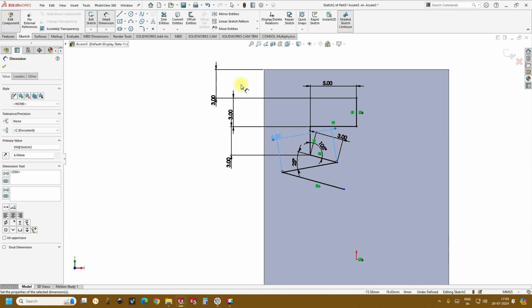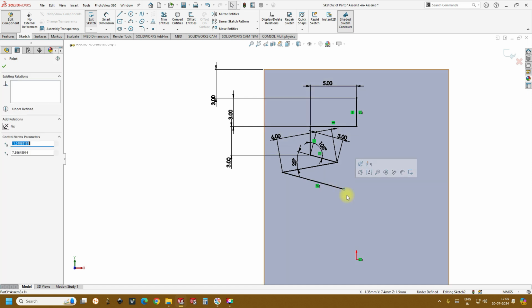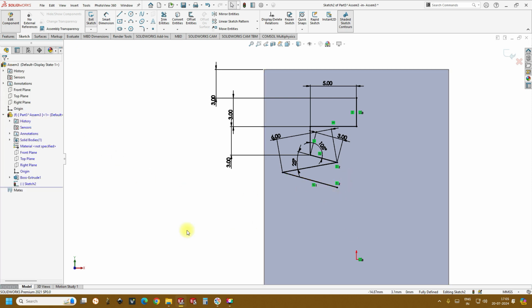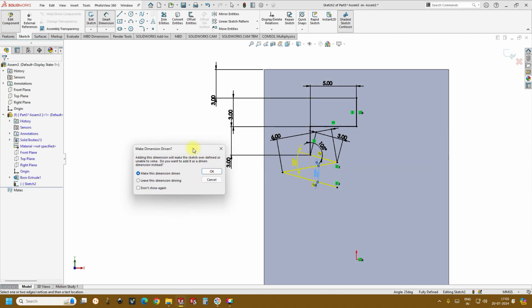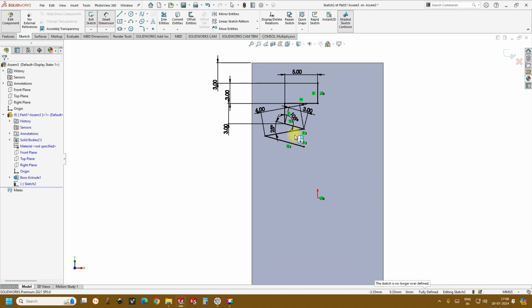Okay, and then the next thing, we just select this point and control press this point, so you will see the option vertical over here. Click vertical, so automatically it takes this place, and now if you see, the angle between this and this is also 25. So if we give this 25 again, it is an overridden dimension which is not required, cancel. So now we have just this sketch.